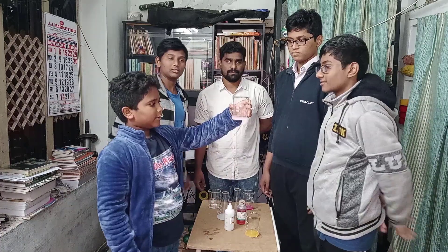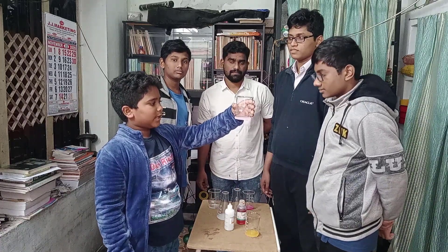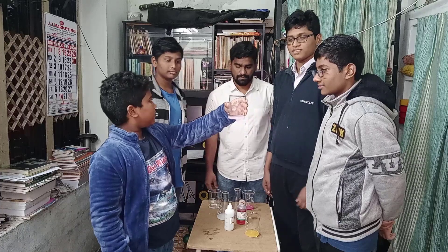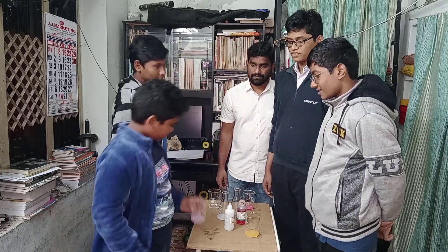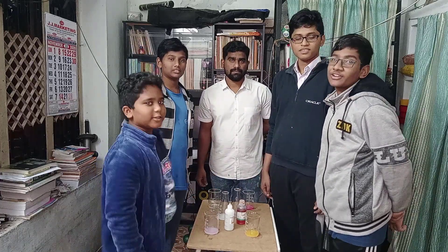The base turned pink color. Thank you, thank you guys, thank you friends.